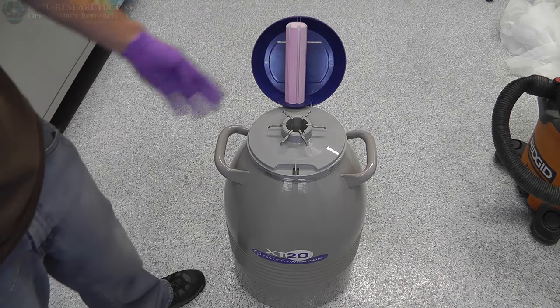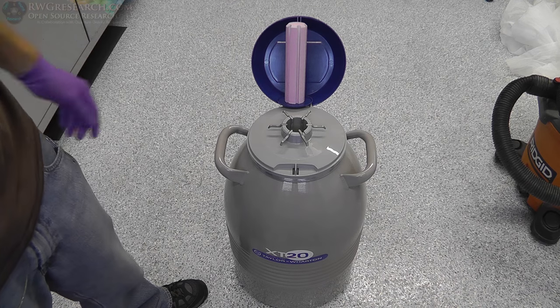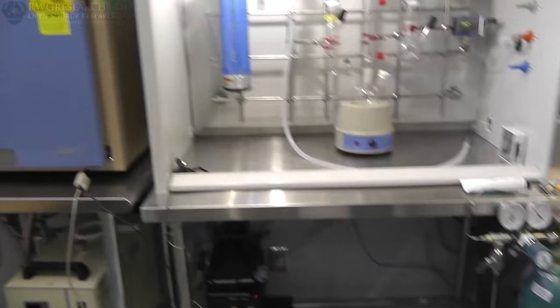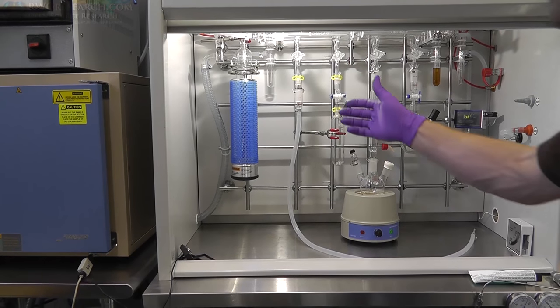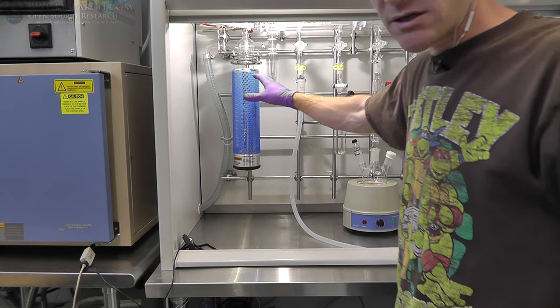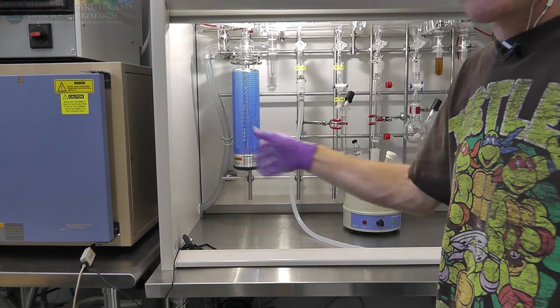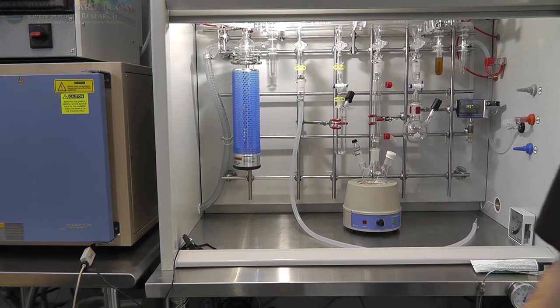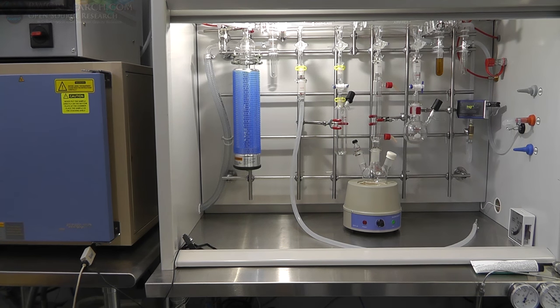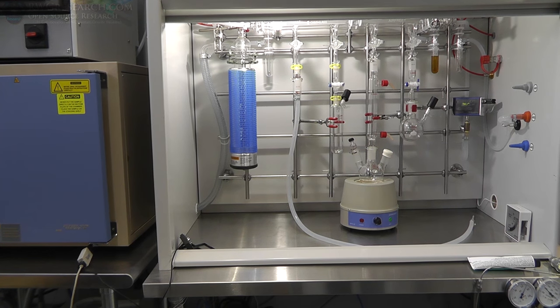So anyway, we would pour this, or in this case probably use something else to dip it out, and put it in the small dewar, hook it up to the Schlenk line, and now everything that's being vacuumed out of this right here will actually condense inside of this and not allow it to go out, so any chemical vapors or anything like that. So yeah, that's about it, I guess.